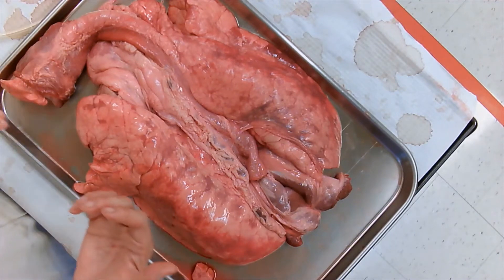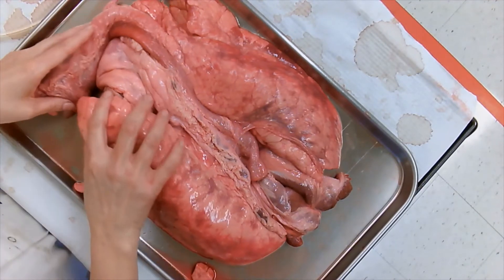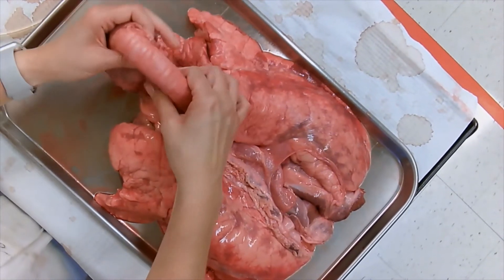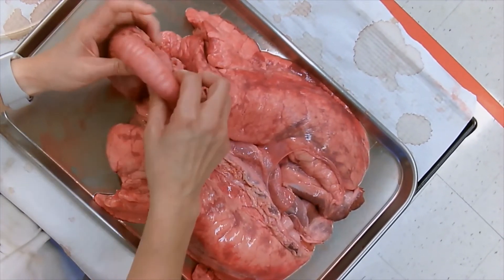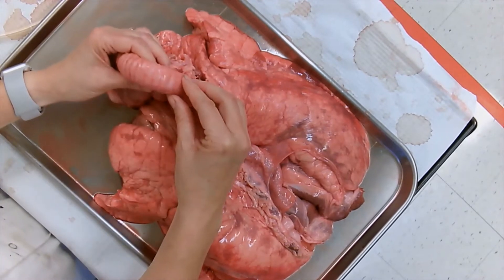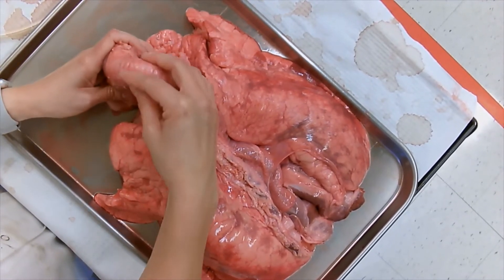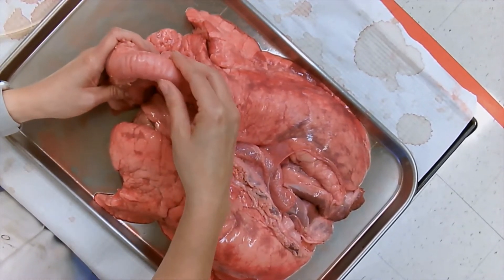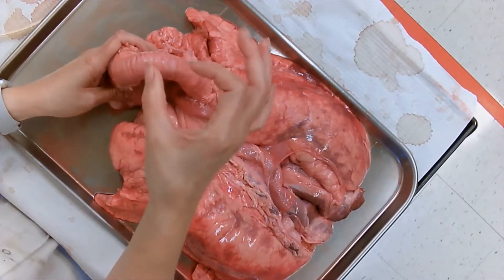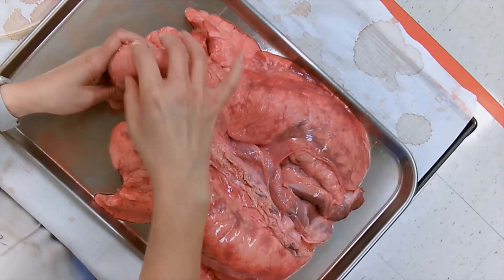Now this is the trachea. You can see it's all hard and bumpy — this is all cartilage, all cartilage rings. But they're not actual rings — they don't go in a full circle, they're actually made like a C.